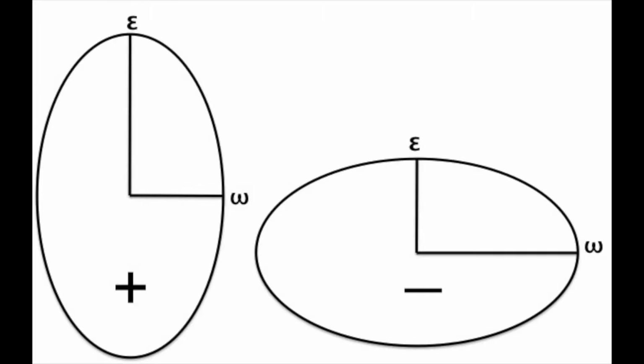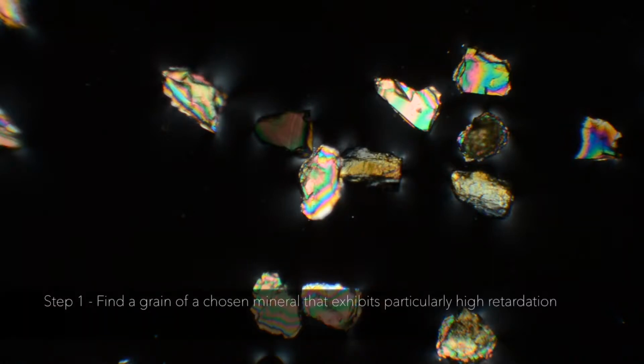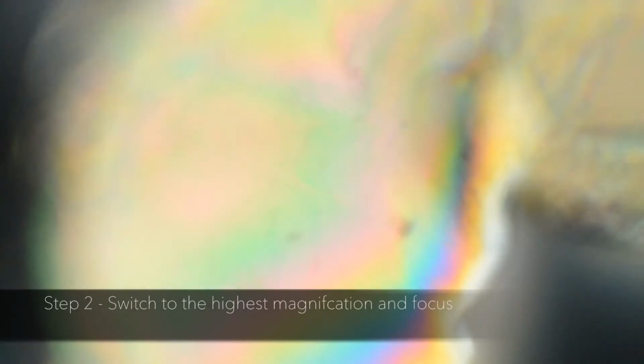Now, let's go through the steps to acquire a flash figure. Step 1. With the cross-polarizing filter in place, find a grain of a chosen mineral that exhibits particularly high retardation and interference colors. Step 2. Switch to the highest magnification and focus.